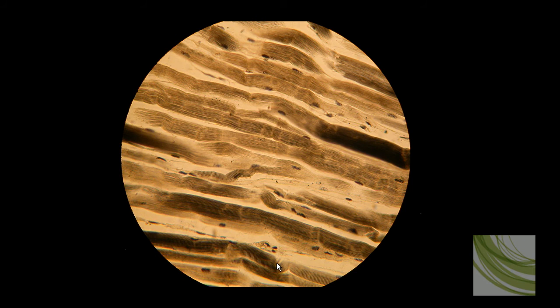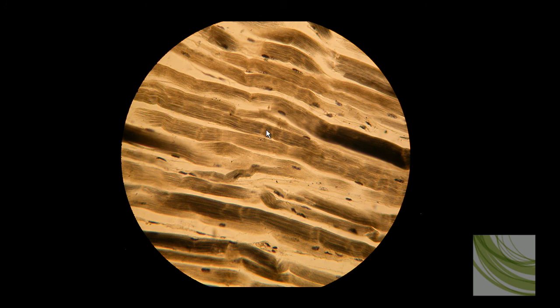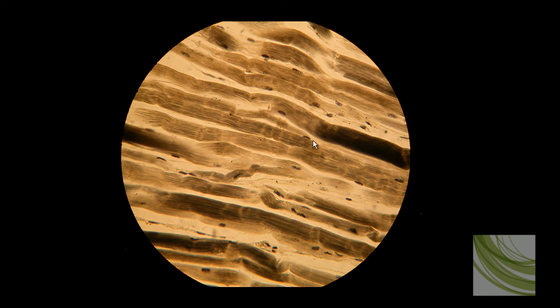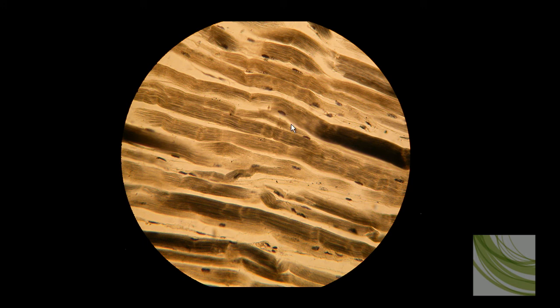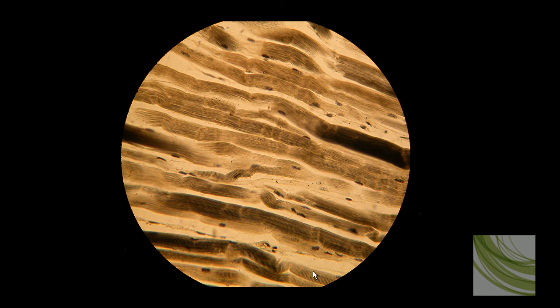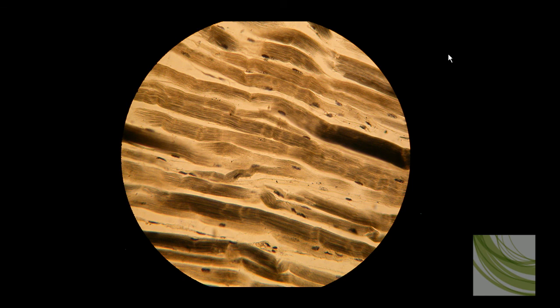Here is that same slide using the 40X magnification. We can see the kinks in the fibers, but you can really see these striations. Notice that these cells are long cylindrical objects lying next to each other, and the nuclei are on the outside — the exterior — of the cell. These little dark and light patterns, these striations, are incredibly obvious in this slide. This is probably the best slide we've seen in this series.